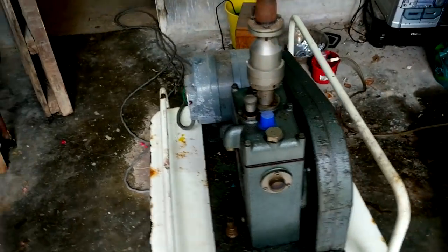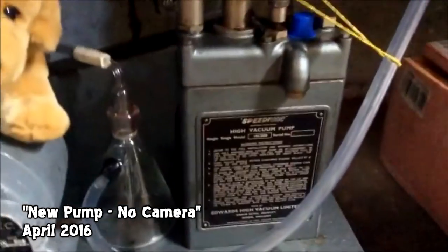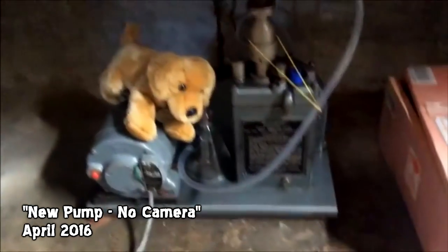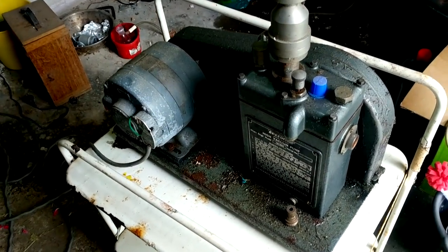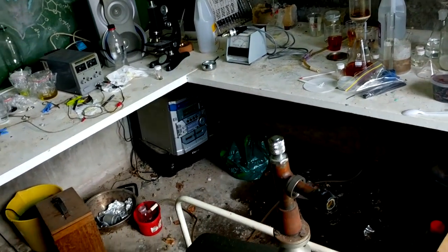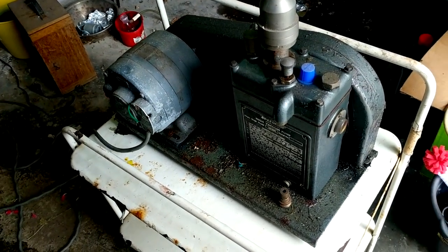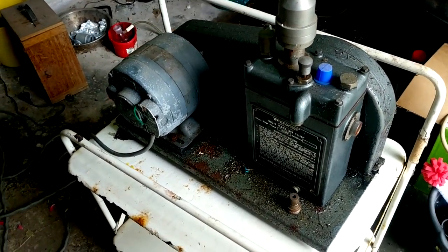It's considerably more rusty than when I put it in there. Comparing to the original video, look how good it was. I need to protect it so it should last forever if I keep water and acid vapours out of it. The lab environment is pretty corrosive — HCl vapours in particular are very bad at causing corrosion, so I tend not to leave anything out these days that can do that, but a lot of electronics in my lab tends to suffer.